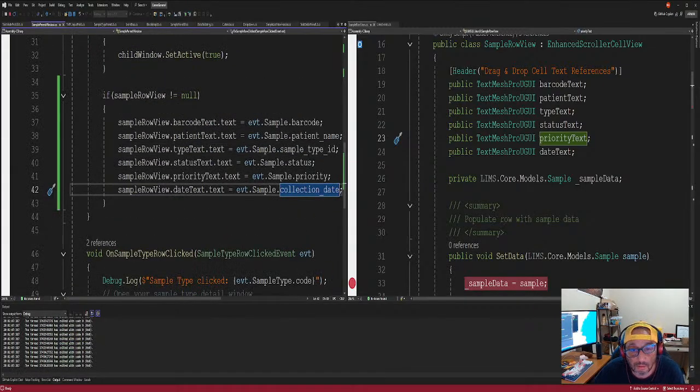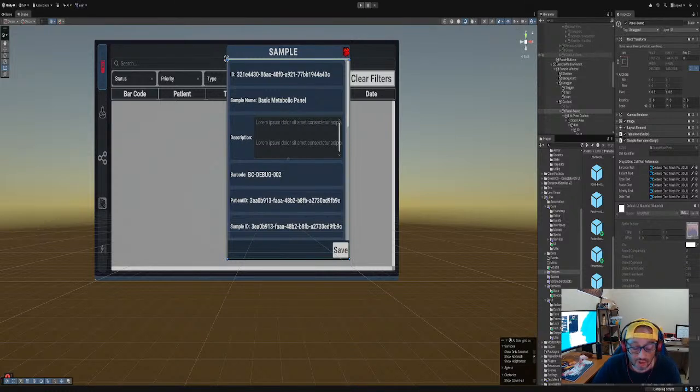And then, do we have a reference to that? Yeah, we have to make a reference to that. We have to drag and drop the reference, which I put on panel saved. You could put it anywhere you want, actually, and it'll work. But you tend to put it on the object that it actually needs to be on. Hold on, we're waiting for this. Just me adding that code is slowing it down. Well, anyway, there we go.